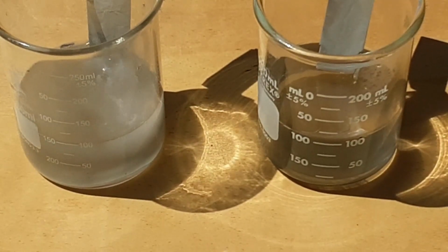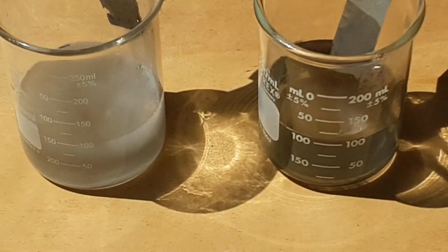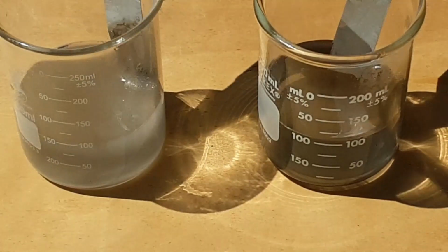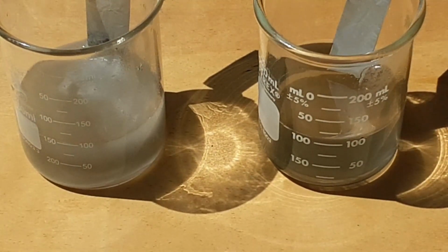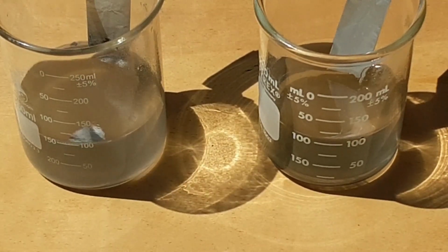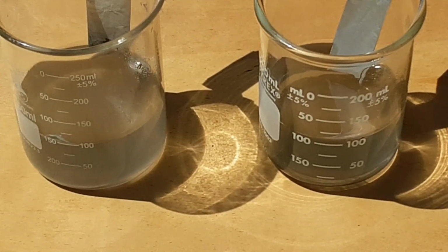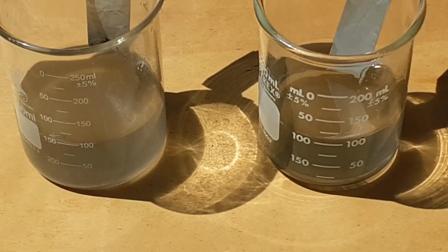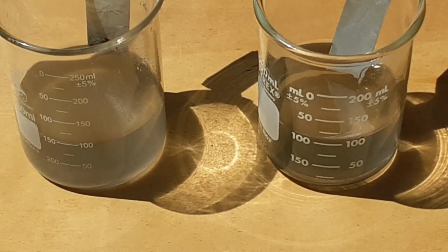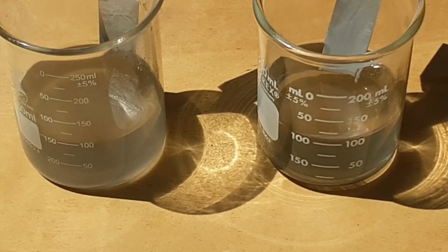Right now I'm basically at the 8-minute mark. So after 8 minutes, it's pretty much through that one. At this point, the results are pretty obvious to me that the potassium hydroxide definitely ate through the aluminum faster than the sodium hydroxide did. But that defeats all the information that I looked up on this. So there has to be a mistake that I made here, because that just shouldn't be. Basically on the potassium hydroxide, within 5 minutes, give or take a little bit, it completely ate through. The sodium hydroxide finished the foil off roughly 4 to 5 minutes later.